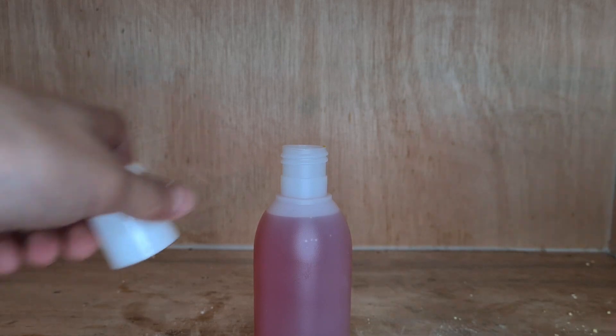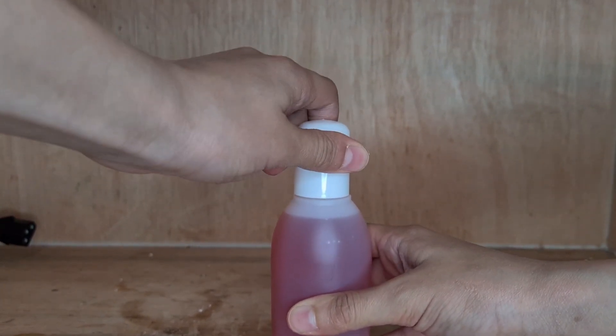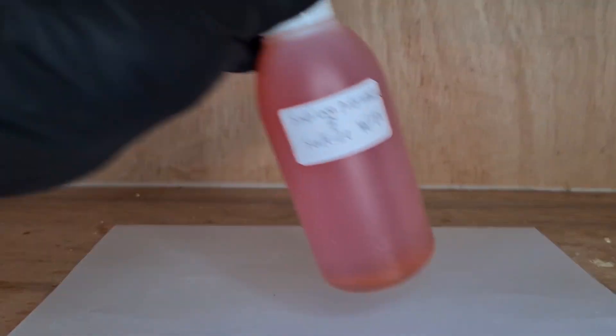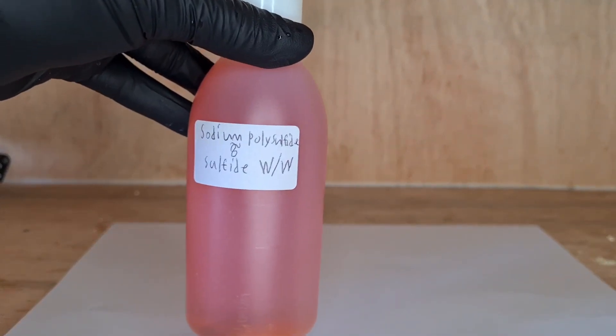Now the bottle is capped and we're left with a nice final product. Okay, now that I've labeled the final product, I'm completely done with part one of this series.